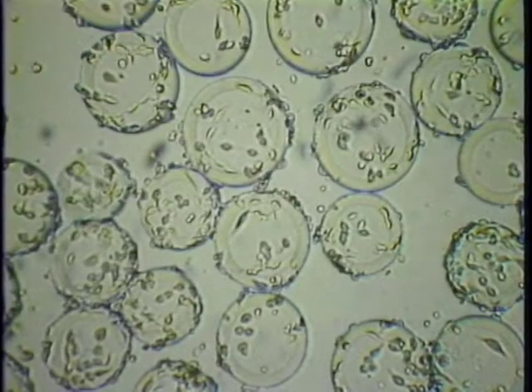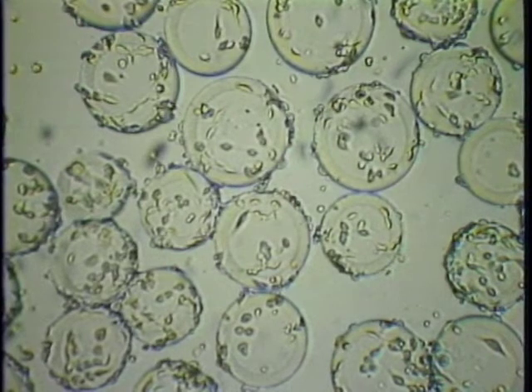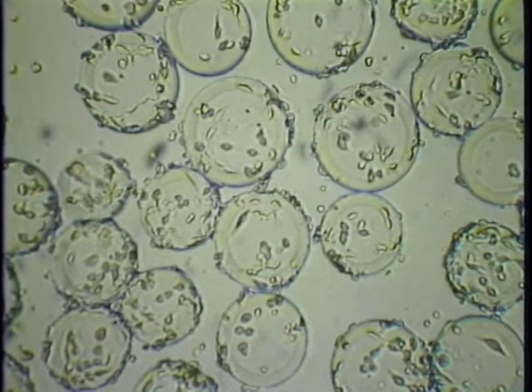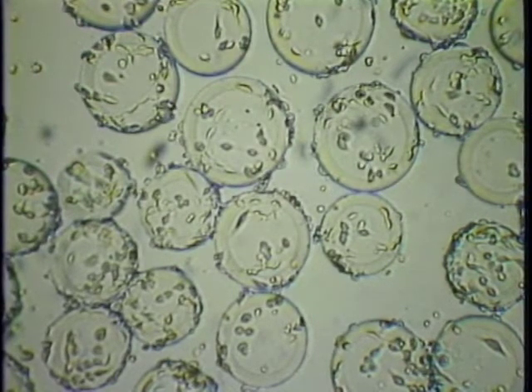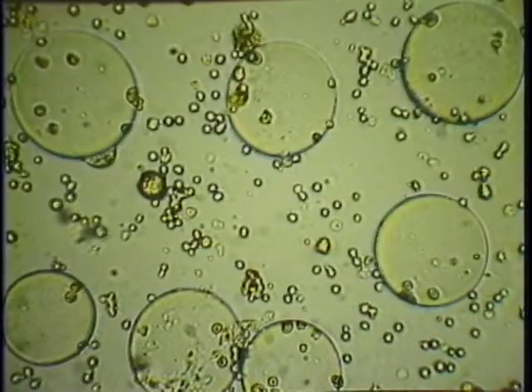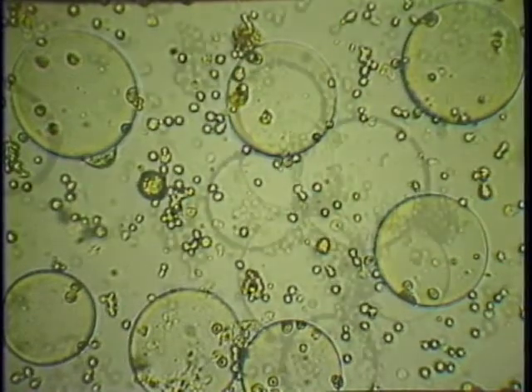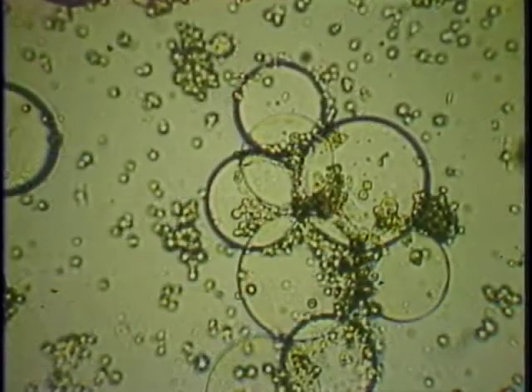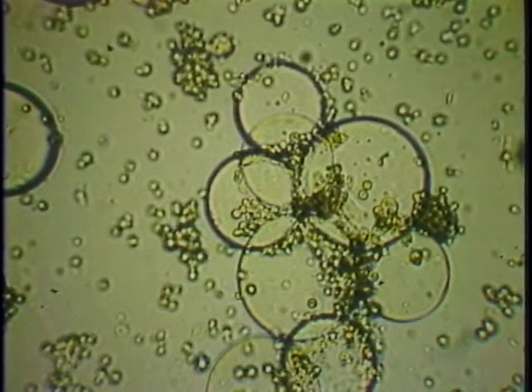A good cell attachment process should allow for most cells to attach within two to three hours. If the attachment process is too slow, aggregates may begin to form and viability may decrease.